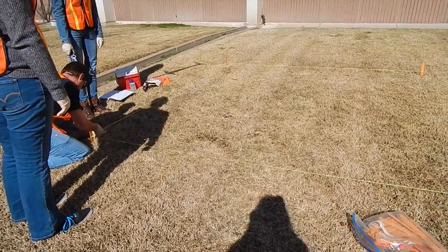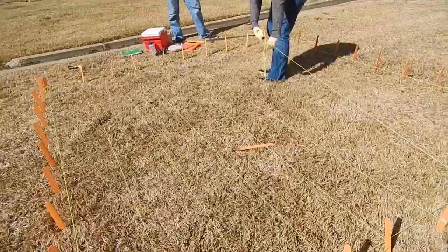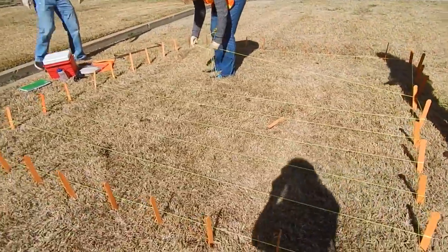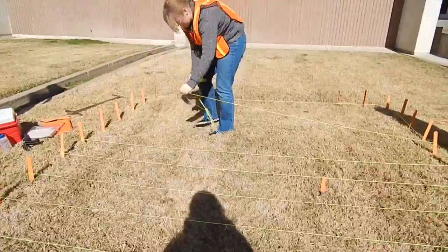In this example, a 10-foot by 10-foot grid west of the Peterson building was plotted on the Texas A&M University campus. To begin sampling, decontaminate equipment using deionized water and ensure that it is in working order. Samples are collected from the near-surface soil using a trowel.